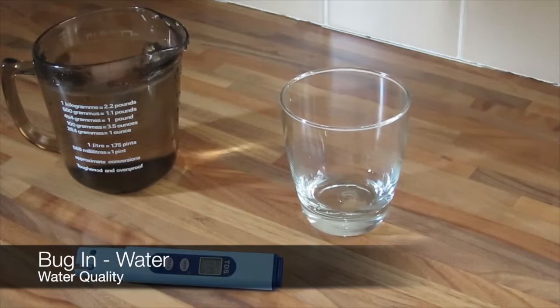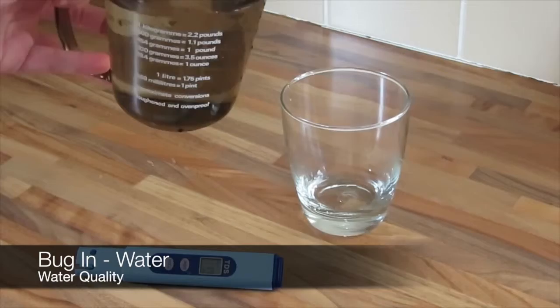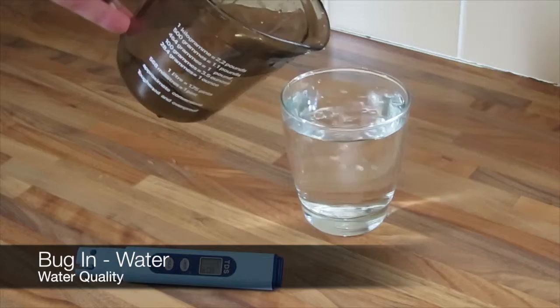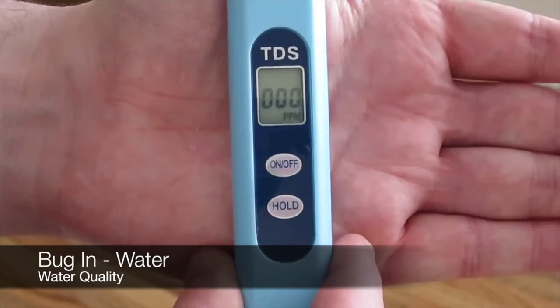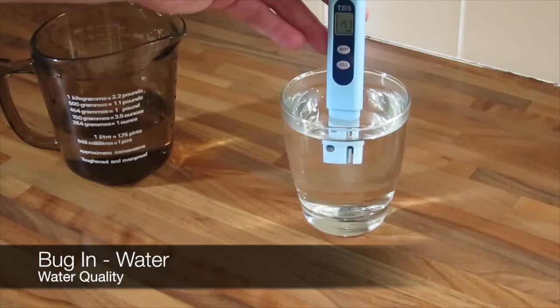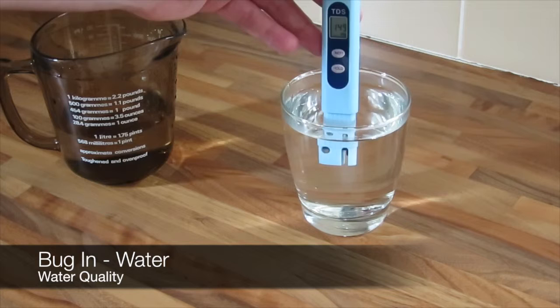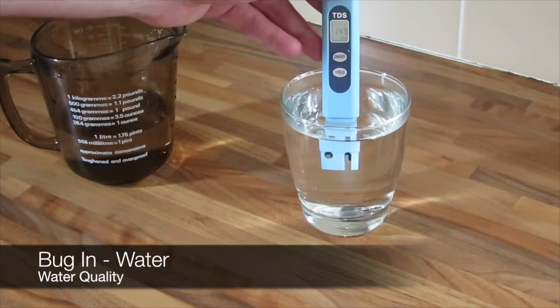Right guys, so I just filled up the measuring jug again with water from the hot tap this time. We'll just pour that into the glass and then we'll take a reading. Now before I take the reading, what should happen and what we should see is that the reading is actually higher. I'm not expecting it to be significantly higher but it should be higher.